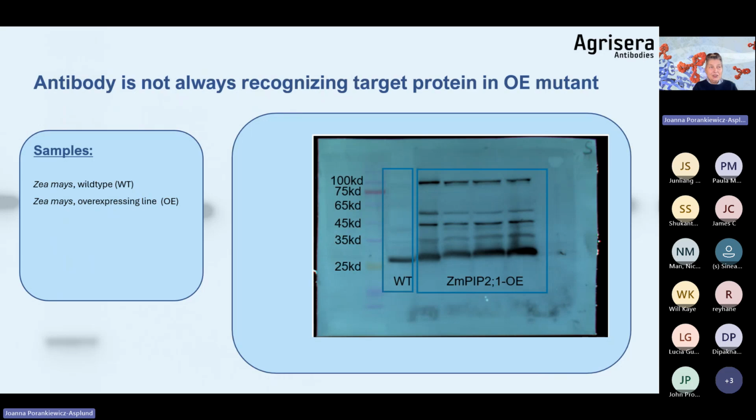Sometimes antibodies are, as I mentioned, not recognizing the proteins. Here we have the wild type. This is a PIP protein, so a plasma membrane protein in maize. And as you see, there is a very nice band of target in the wild type. However, here we have a transgenic material, and that antibody should recognize a band around 54 kilodaltons, but this pattern is rather showing that the antibody is not recognizing the recombinant target. So such a situation is possible. Maybe addition of a denaturant like urea could help to make it more accessible for the antibody to bind. But in the setup which was conducted in this experiment, it was not possible. So here the antibody detects only the endogenous protein, not the recombinant one, which should be up here.